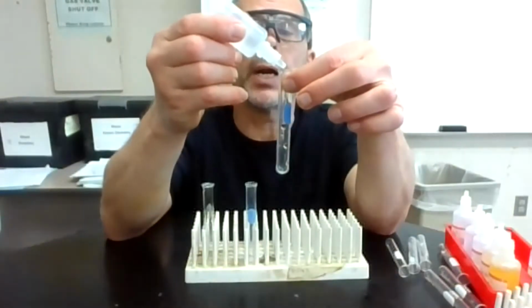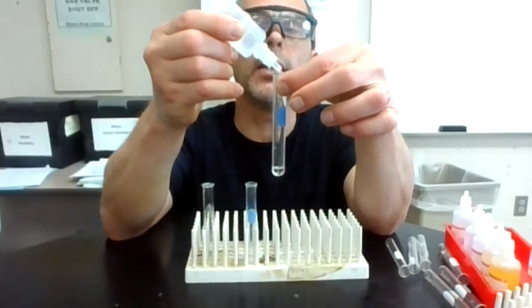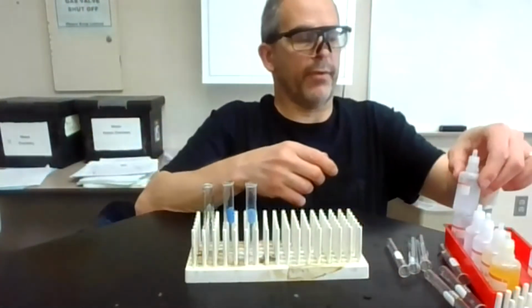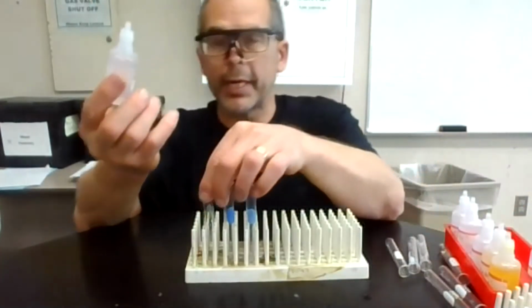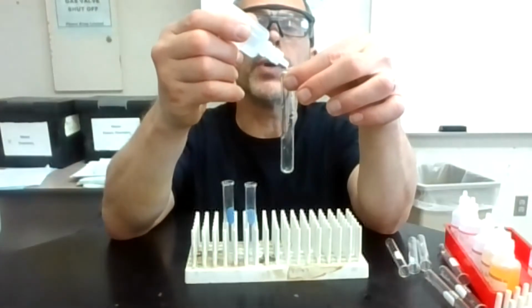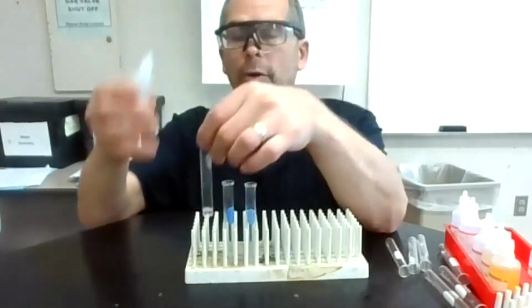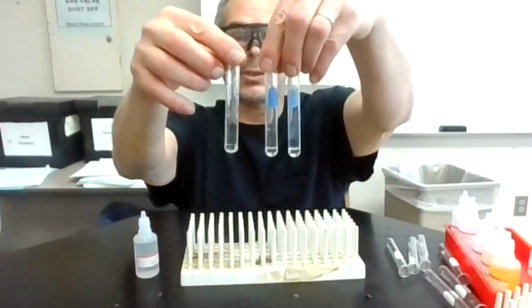I'm going to do the same thing with barium nitrate. 1, 2, 3, 4, 5, 6, 7, 8, 9, 10. And again, I'm trying to put 10 in. If I put 9 or 11, it's going to be fine. Things get pretty clear cut in these cases, so you can be off a little bit in your measurements. 1, 2, 3, 4, 5, 6, 7, 8, 9, 10 zinc right here. So it looks like they're all clear solutions, which is what we expect. They were clear in the bottles.